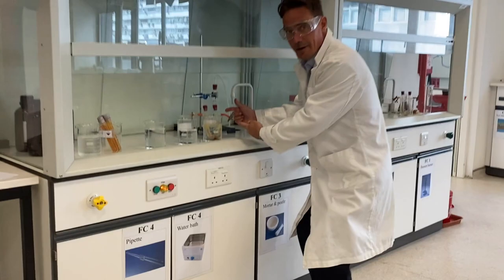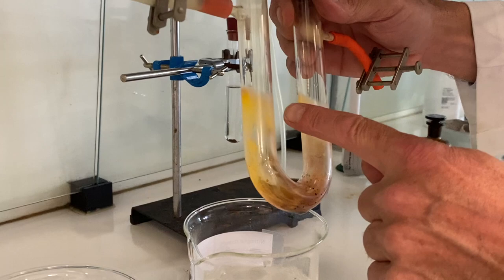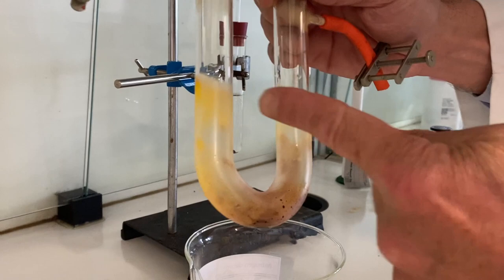Exciting stuff. Open the fume cupboard. Let's keep up. Ta-da! Oh, that's not so amazing. I mean, but quite clearly at the sides, yeah, we have got more yellow formed.